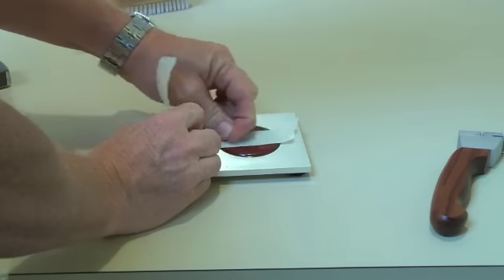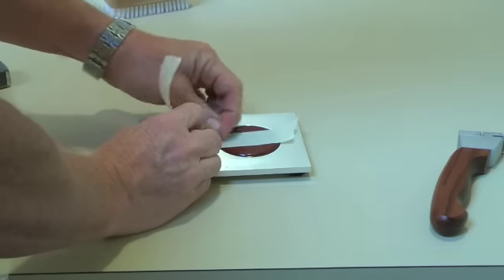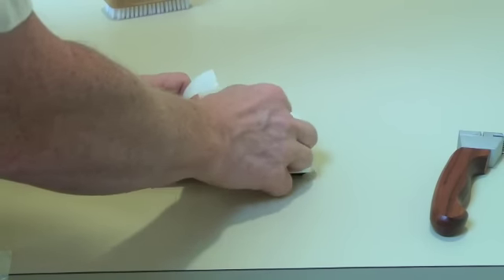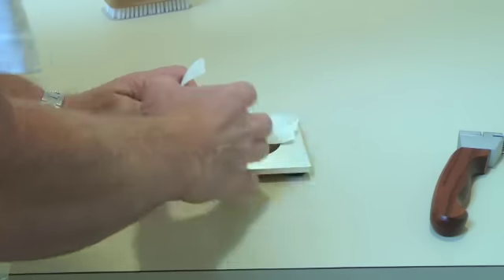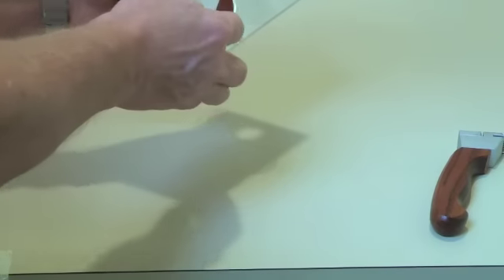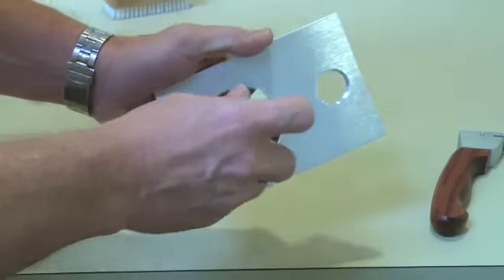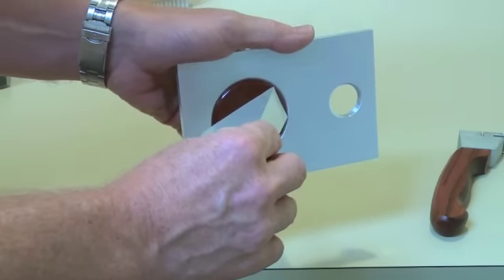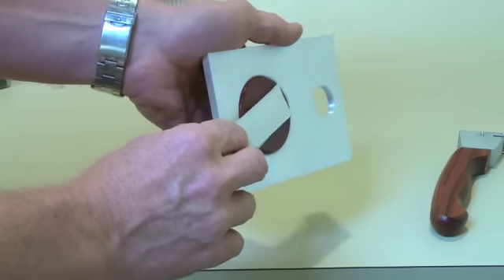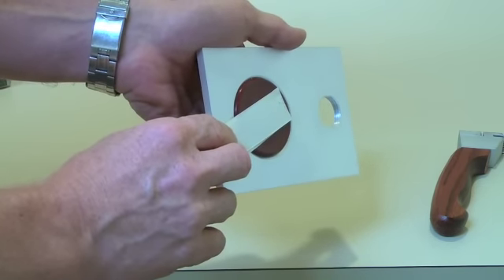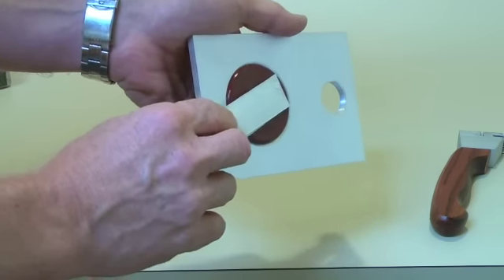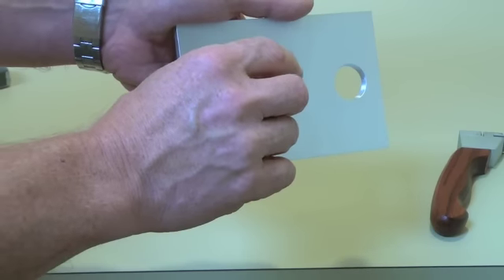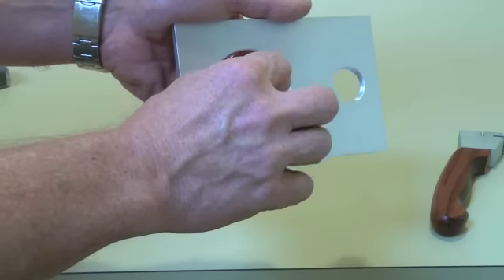I am going to rub it in with my fingernail to get good adhesion to the tape. Now, we are going to pull the tape off at an angle, 60 degree angle according to the ISO specification, 180 degrees if you are using the ASTM specification. We are going to pull it off without jerking, but we need to pull it off within one to two seconds.